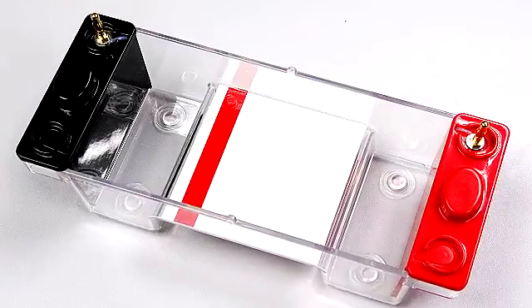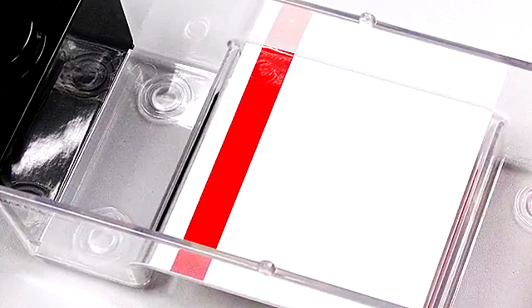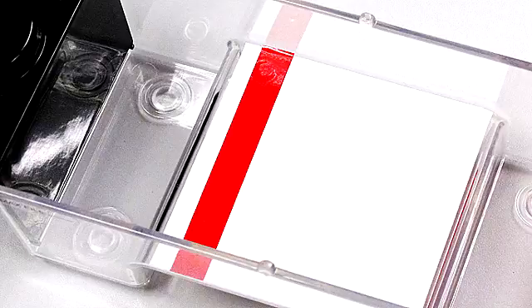If you prefer, the red tape may be adhered to the platform of the gel tank, especially if you intend to view the gel while still on the tray in a UV transilluminator.